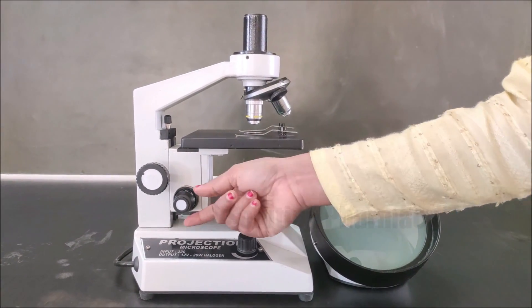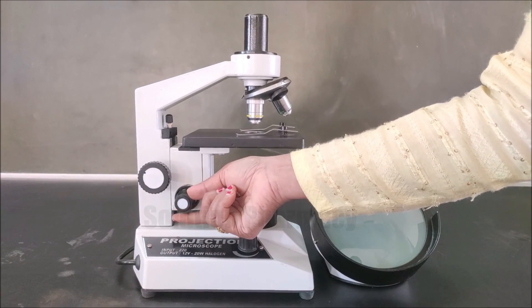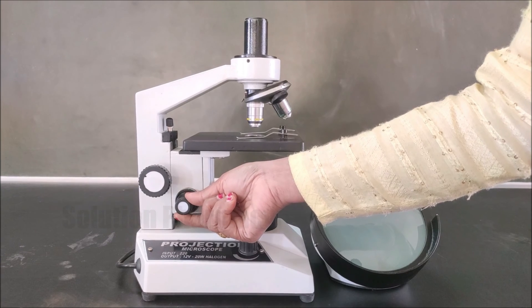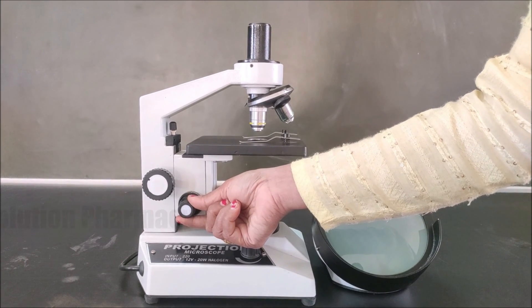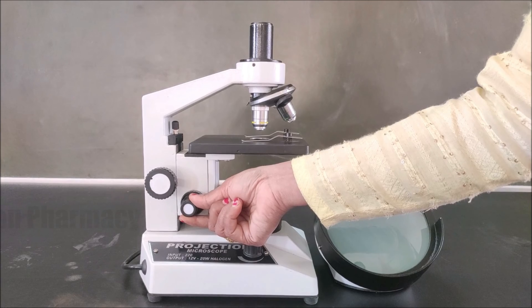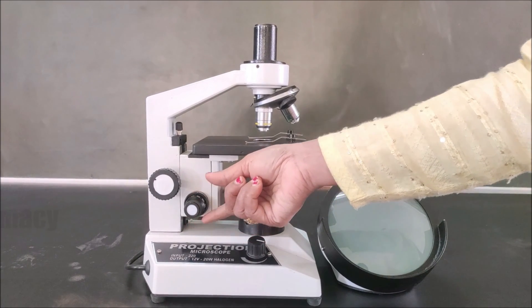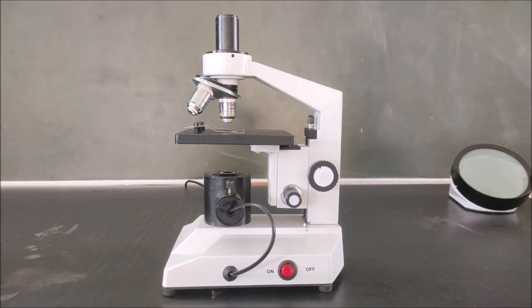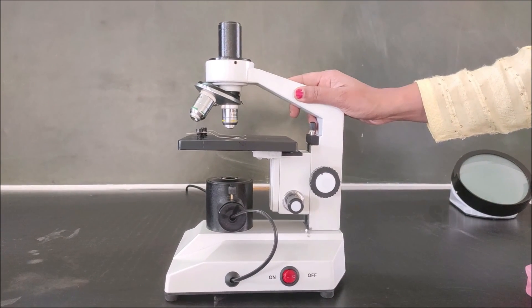This knob is called the fine adjustment knob, and with its help we can observe a fine, clear, and sharp image of the object. By properly rotating this knob we do the fine adjustment of the image of the specimen projected on the screen.